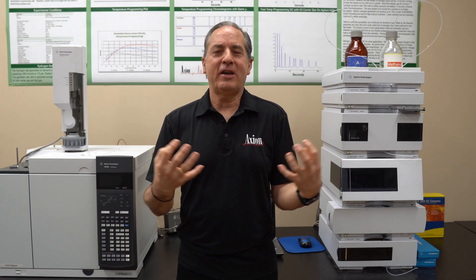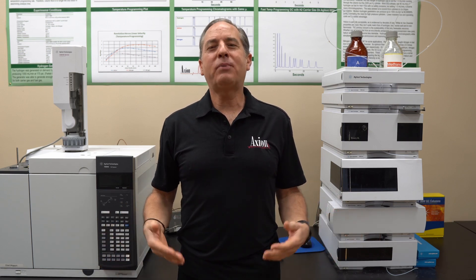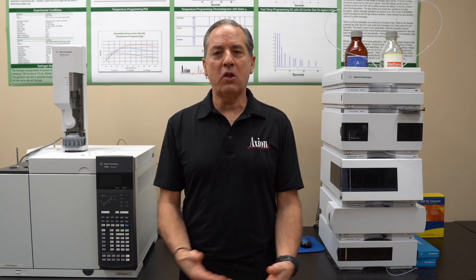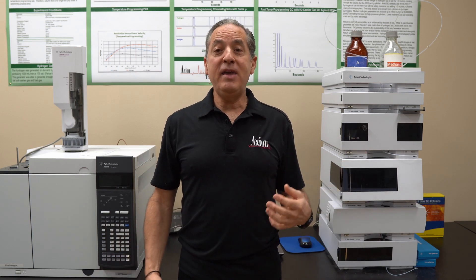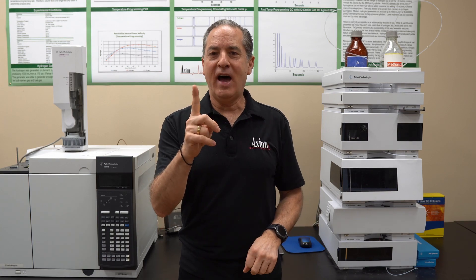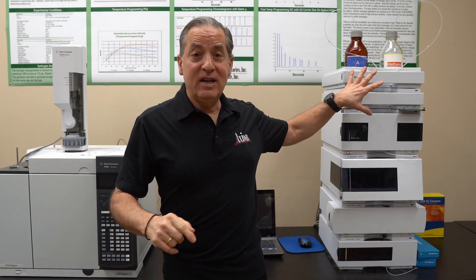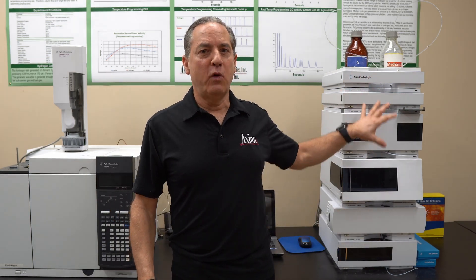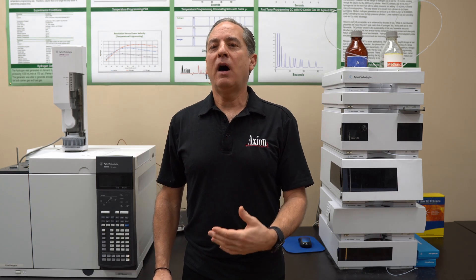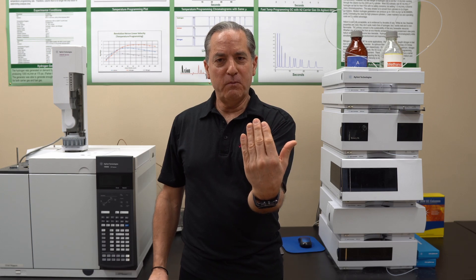Another philosophy I use in troubleshooting: if all the peaks tail, you probably have a physical problem — or they're all bases. But if you have 10 peaks and only one of them tails, or if nine tail and one does not, that one non-tailing peak proves the instrument does not have a physical problem — there's no void. So you're one injection away from figuring out the cause, and one step away from solving the problem.